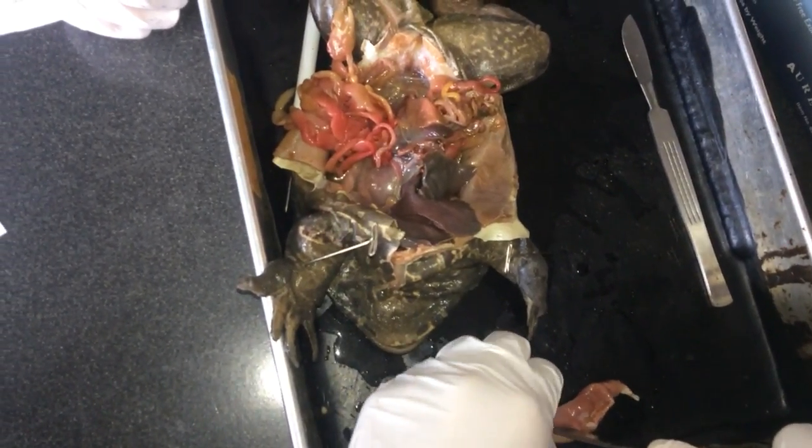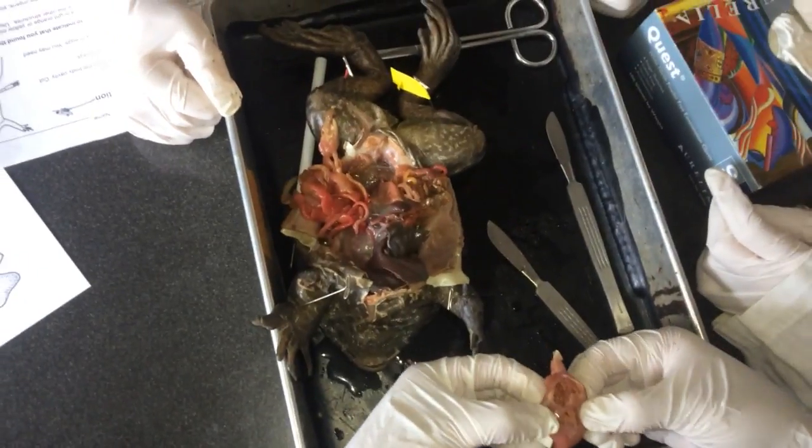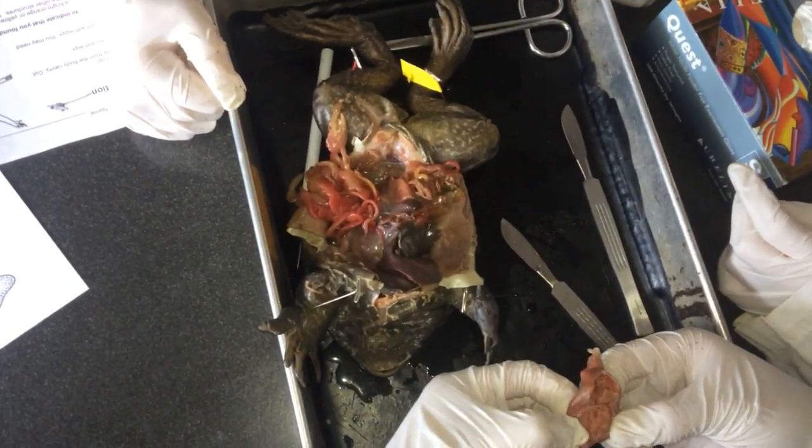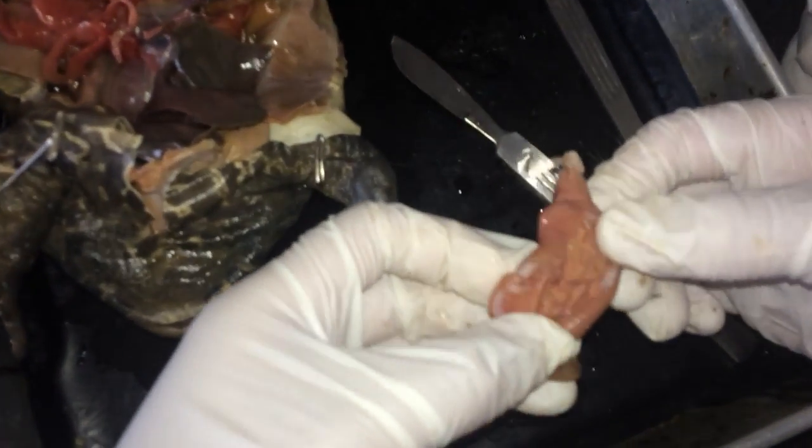If you poke a little hole in it, you think it's thirsty. Yeah. Yeah. I don't think it did. It wasn't even... it didn't even have its last meal.